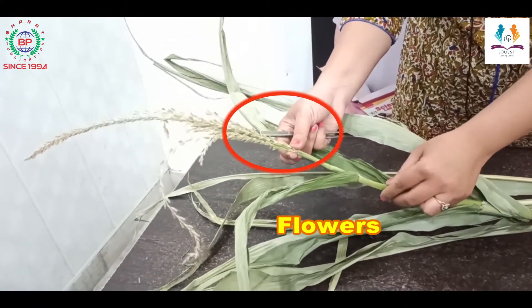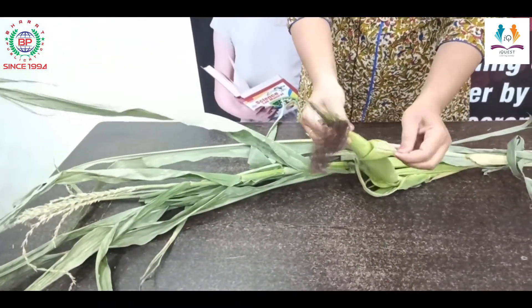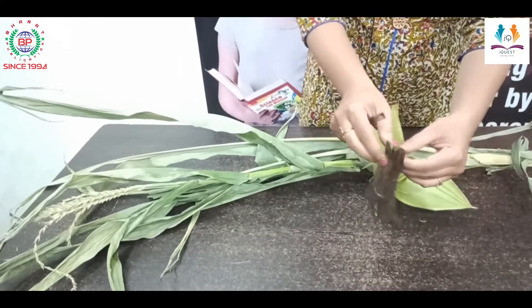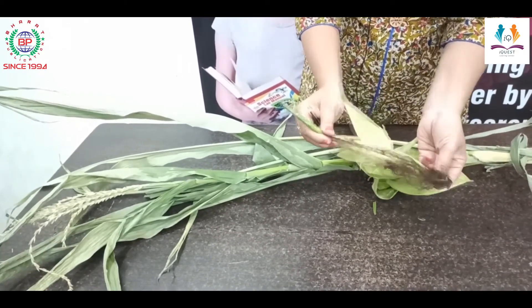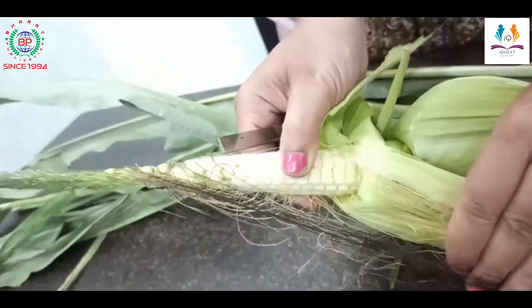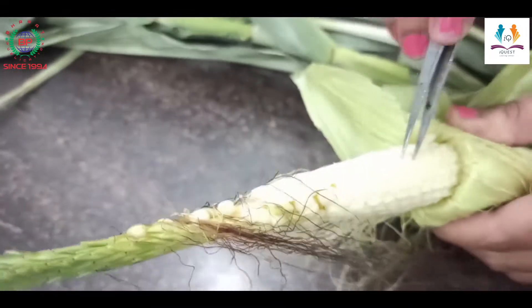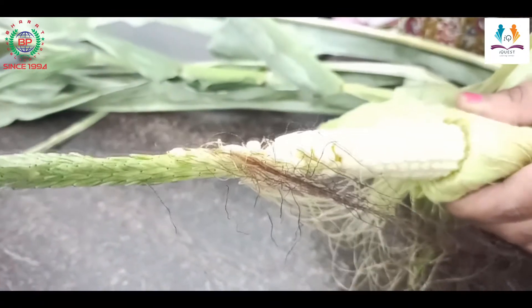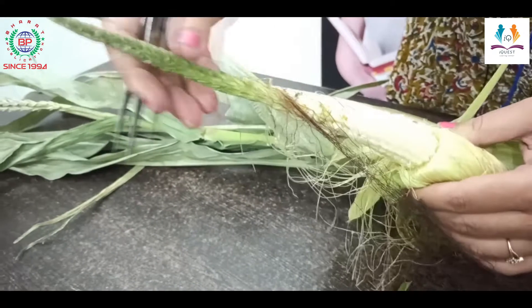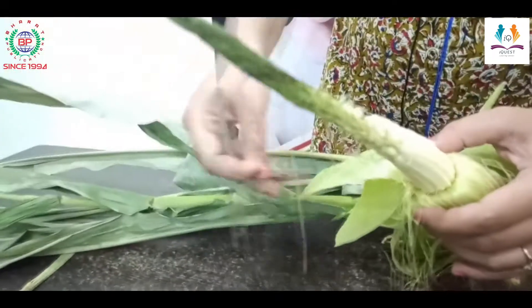Next is the flower. These are the flowers of the maize plant. When pollination occurs, this type of fruit arises. This is the maize — I am removing the outer covering and in between there are ovules. These are the developing seeds — the yellow color maize you always eat. This was the flower; after pollination the ovule converts into the seed.